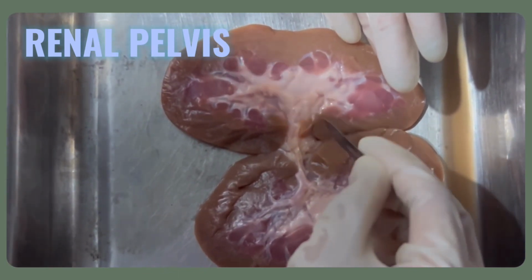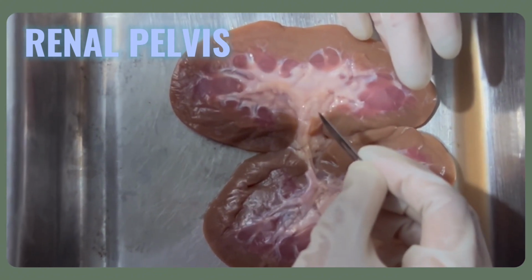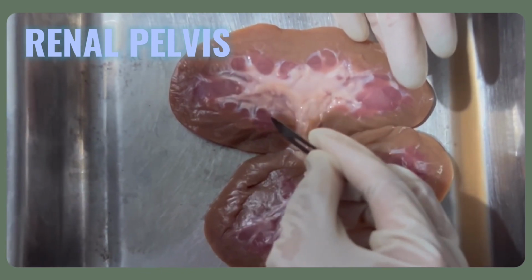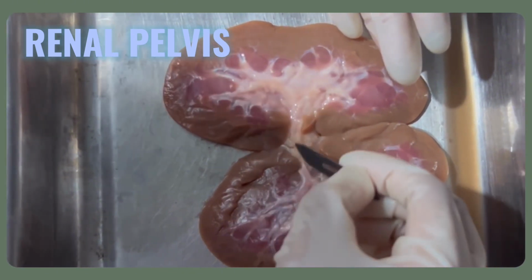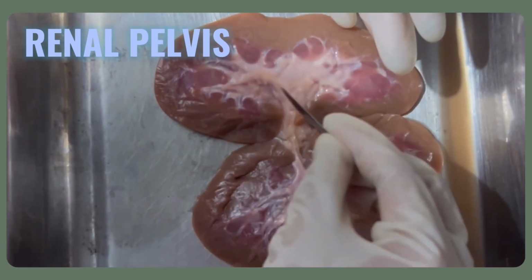The renal pelvis is made up of smooth muscle walls that help to propel and regulate the flow of urine. It also helps to regulate the chemical composition of the urine by reabsorbing certain substances from the urine back into the body.